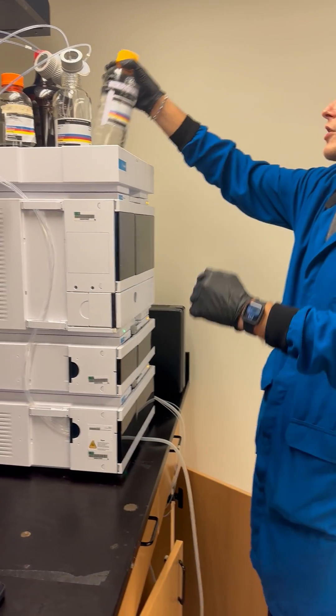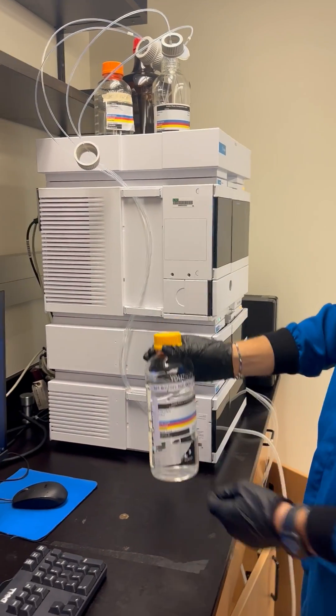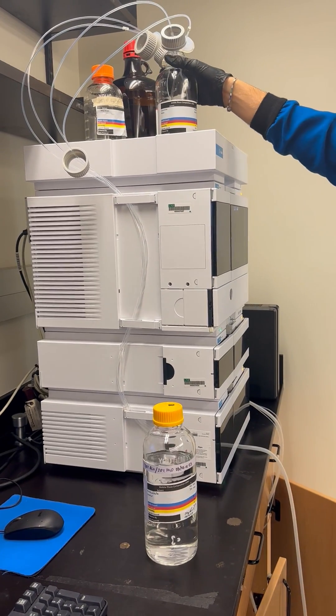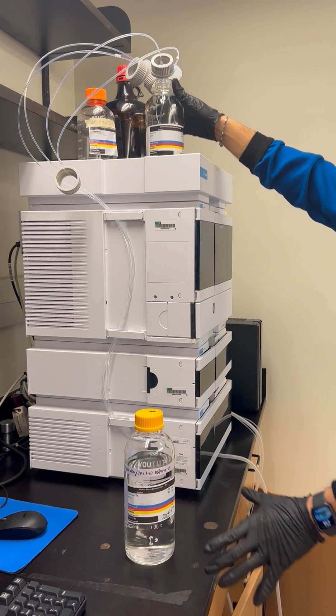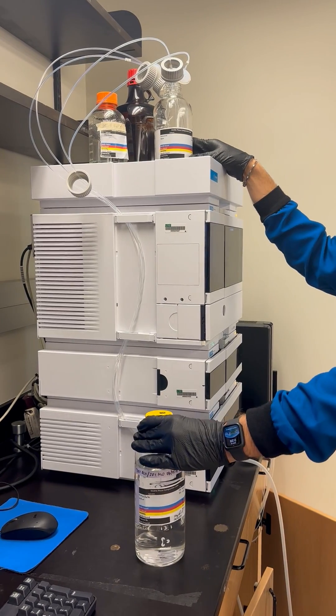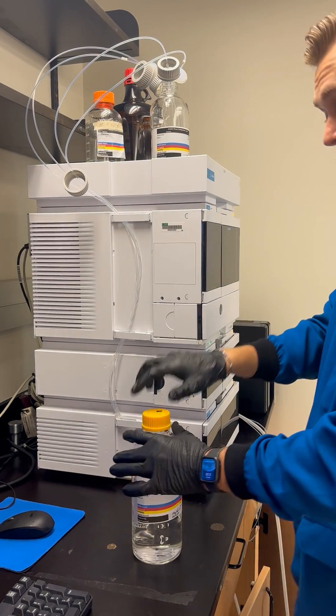Alright, so now we're going to be preparing our lines for our new mobile phase. What we happen to have the instrument in is actually the same exact mobile phase, so technically this isn't really as important, although we're going to cover everything just as if it is.